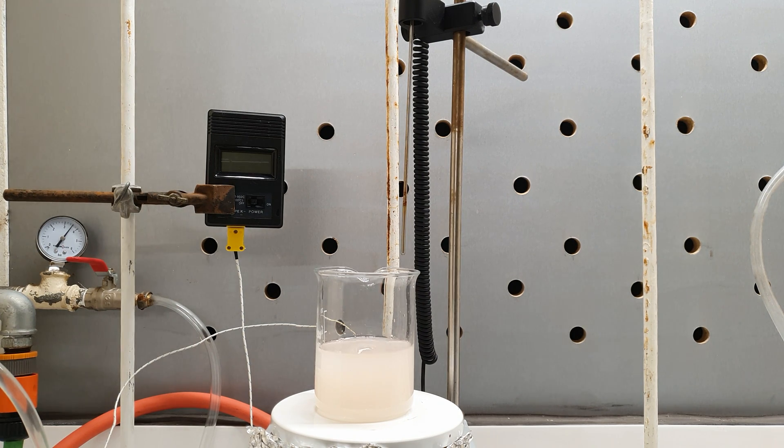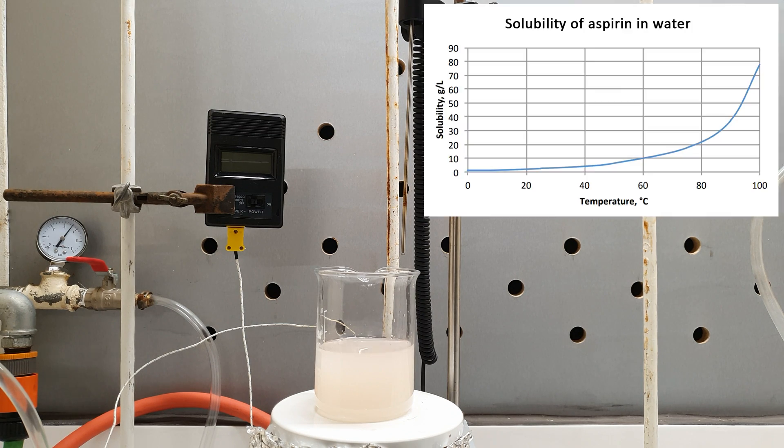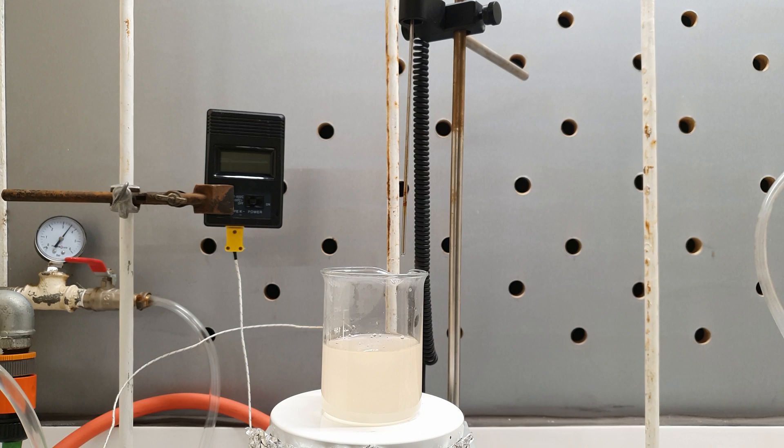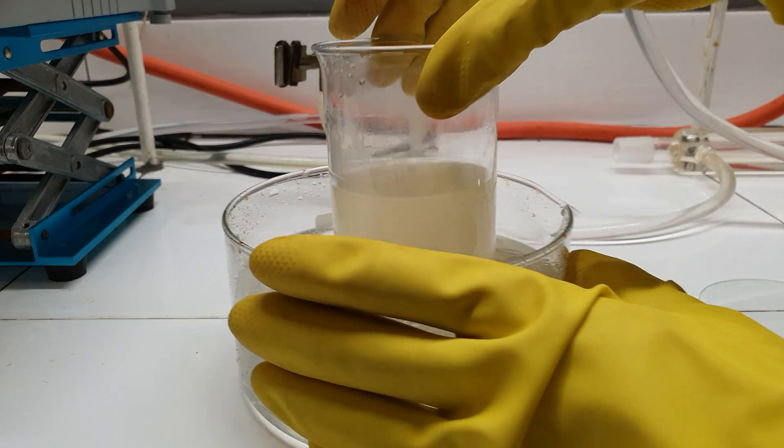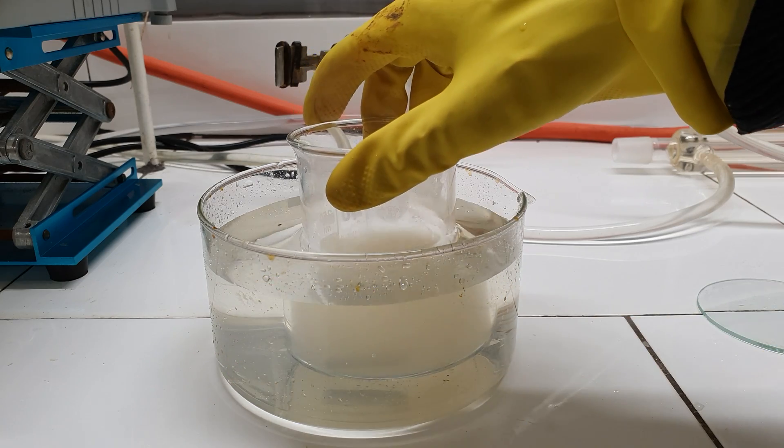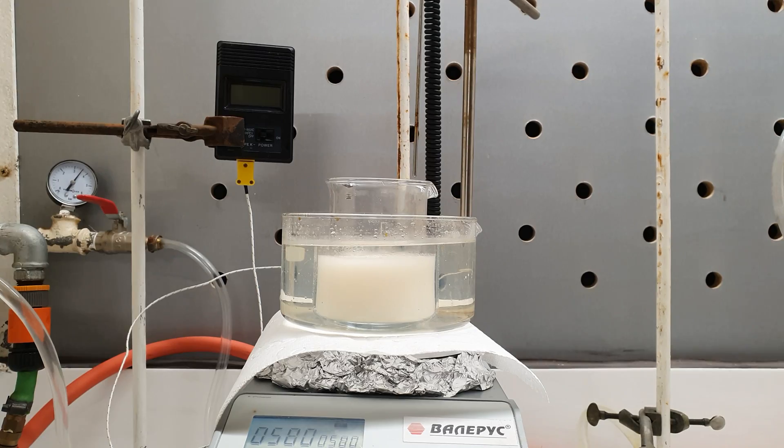When you have such a case you have to improvise using your knowledge and previous experience. Aspirin is very soluble in boiling water but not as much in cold water. So by heating the oil I can dissolve it in the water and then upon cooling the solution it would have better chances of precipitating out. So I heated the mixture until everything dissolved and then placed it in some cold water. Immediately it started to get cloudy and soon a precipitate started to form.